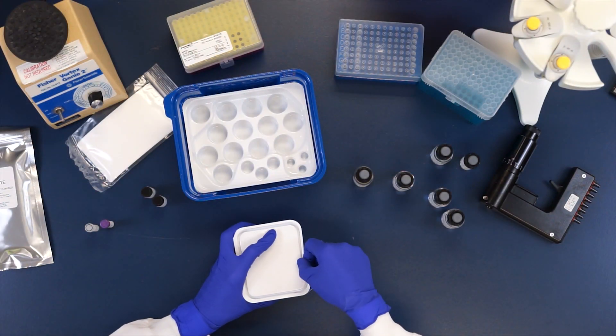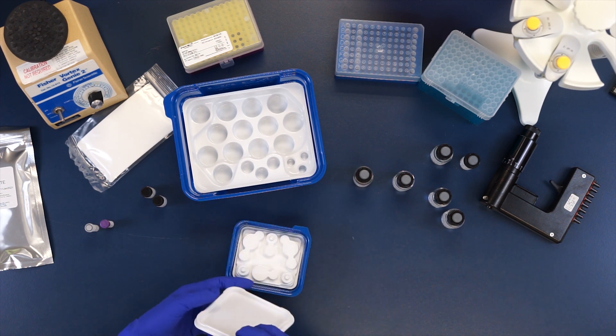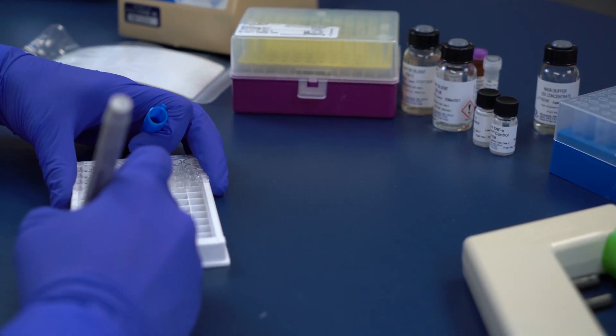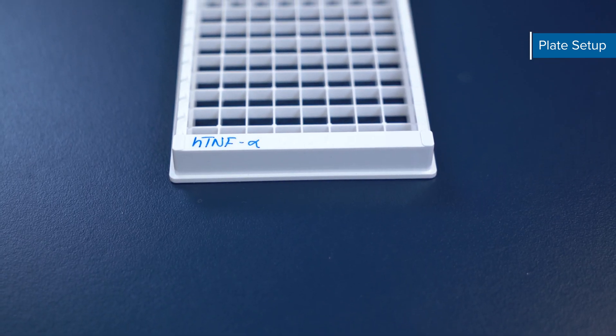This kit is validated for cell culture supernates, serum, and plasma samples. We recommend that all samples are assayed immediately after they are collected, but samples can be frozen for future use. If you haven't done so already, take some time to think about how you'll set up your plate.